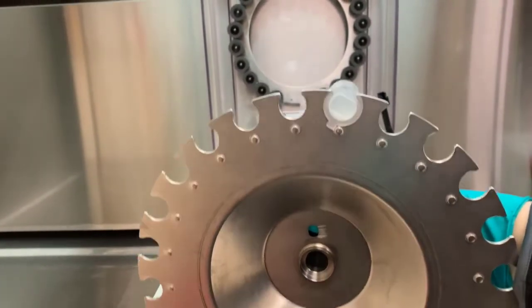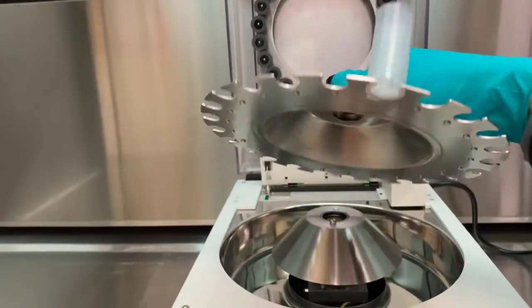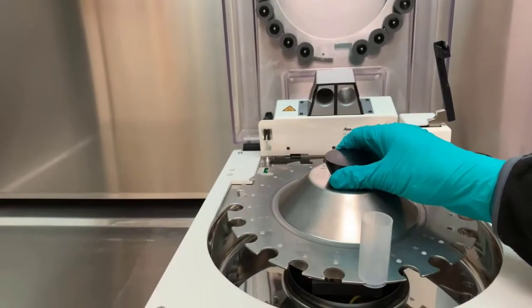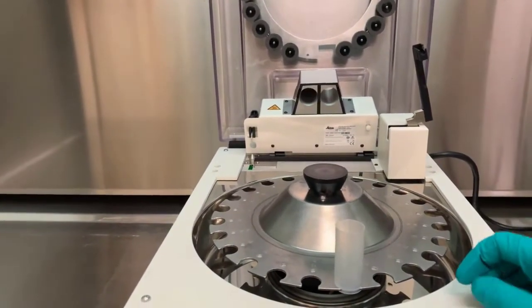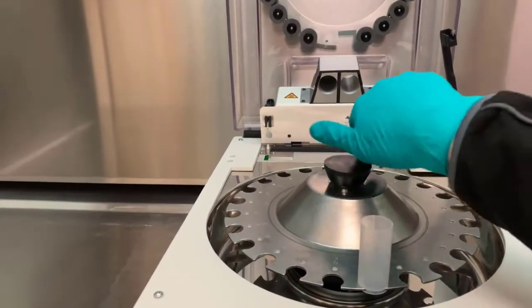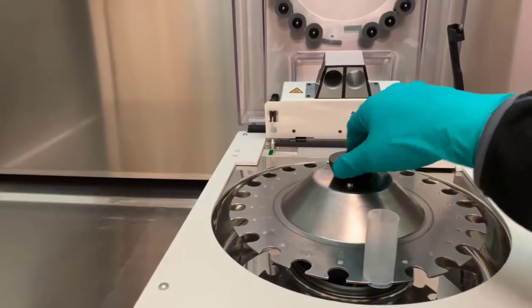Note the carousel has a small hole near the screw such that it can only be loaded onto the EMTP in a single position. This allows the EMTP to keep track of where each vial is located.